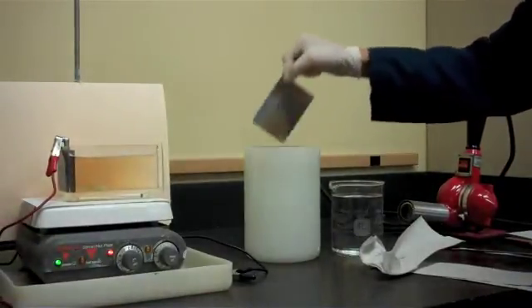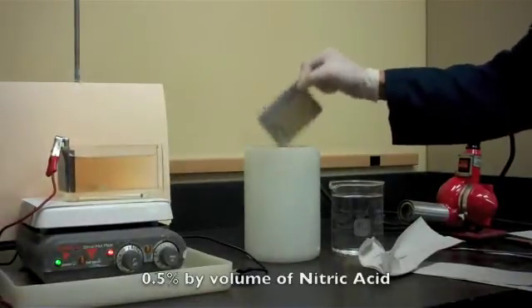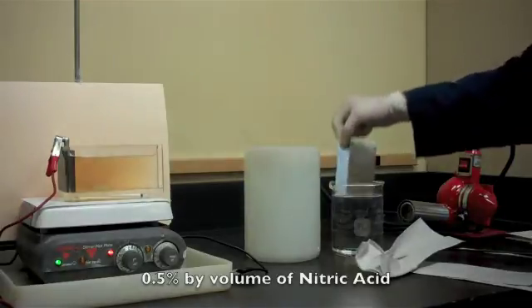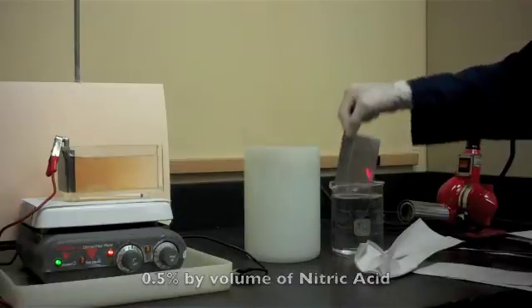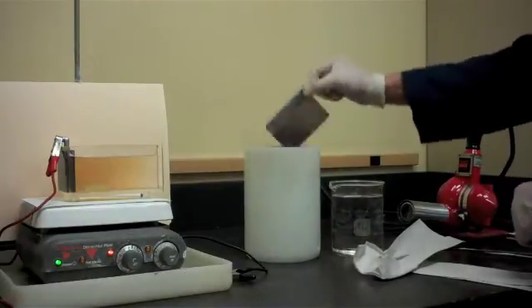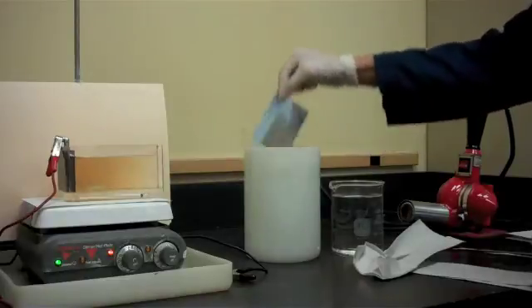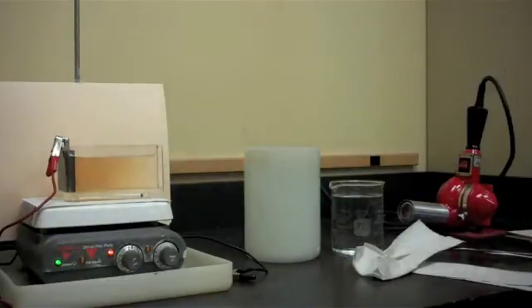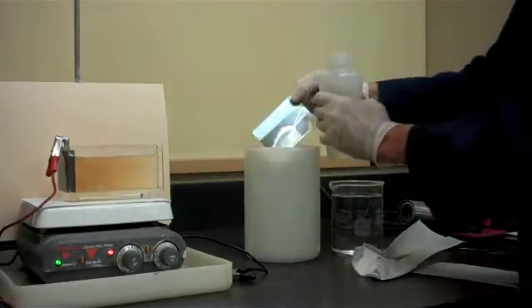Now we will put it in a bright dip of a half a percent by volume of nitric acid, just for a few seconds, put it back into the water, and we will just give it a final rinse of some fresh water.